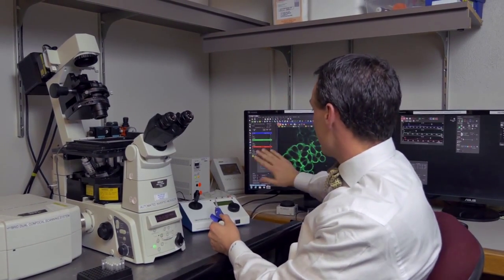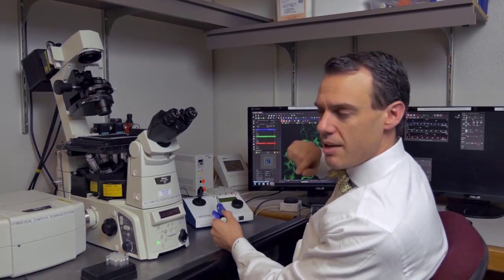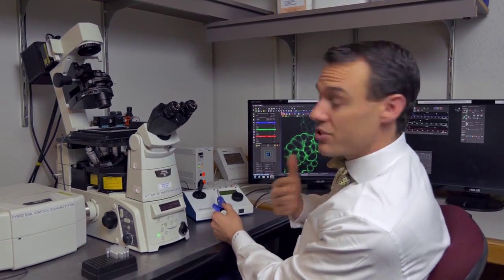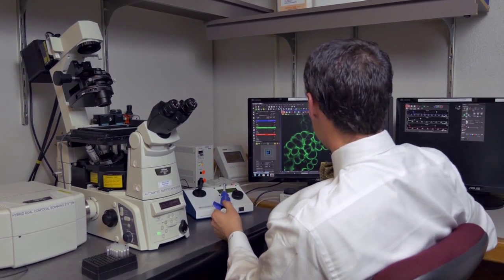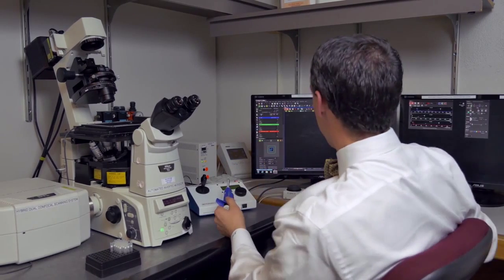Now we are taking just a section, so it's kind of like cutting a baseball in half. That's why you're not getting the full properties, the three-dimensional shape of the cell. That's part of the properties of a laser scanning microscope. And if we go to the red, we can see that there's nothing. Red is indicative of the essential oils, which I have yet to add, and we'll be adding soon.